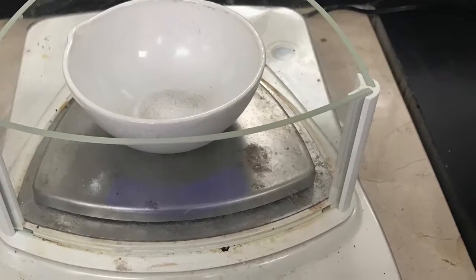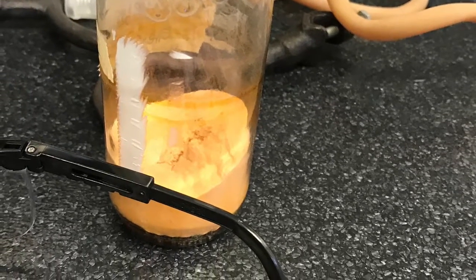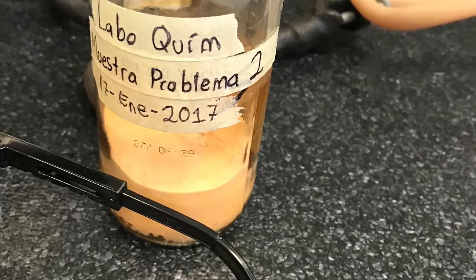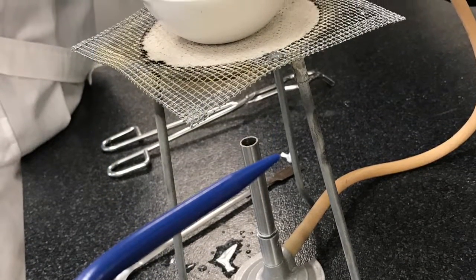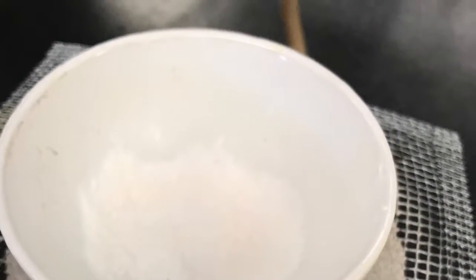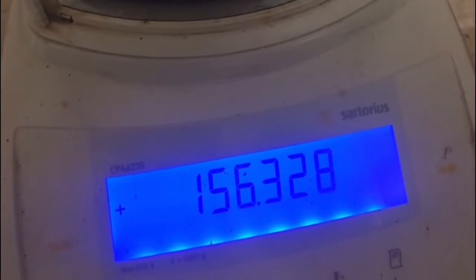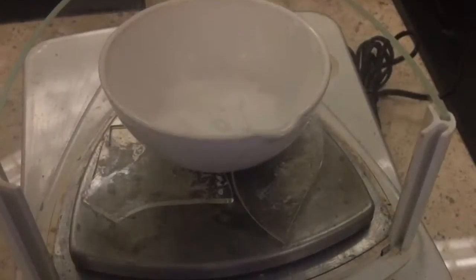In the last part of the practice we did a separation of a solid heterogeneous mixture, and what we did with this mixture was a process similar to sublimation, but we took care and noticed that it just had a change of color. So what we can conclude from the results is that the sample given to us was a sublimable compound. We waited before and after the method, and we noticed that it changed.